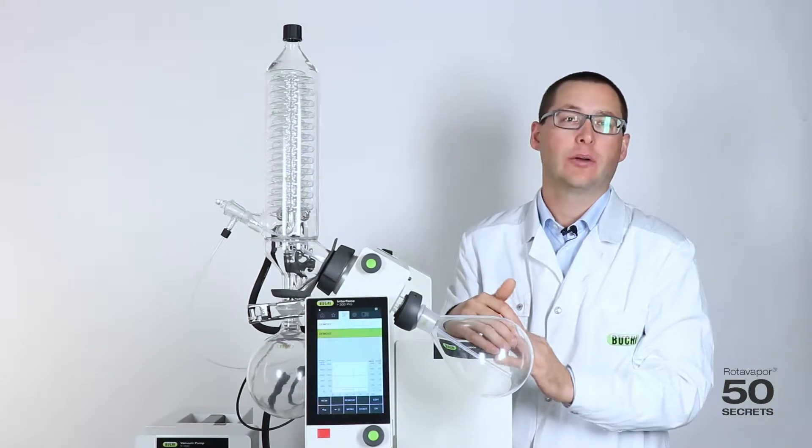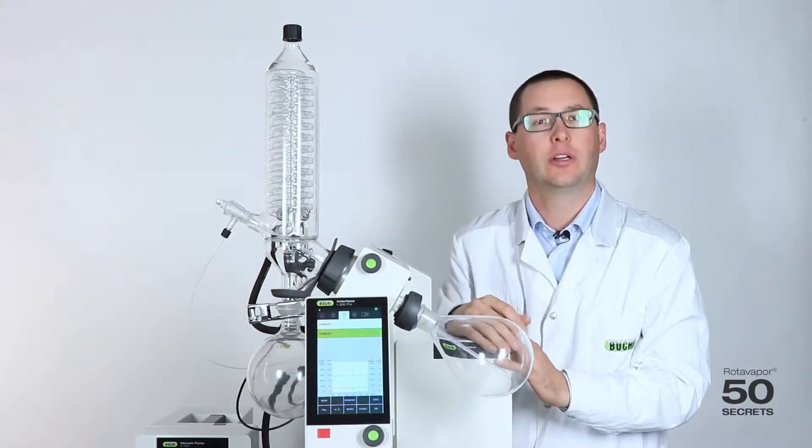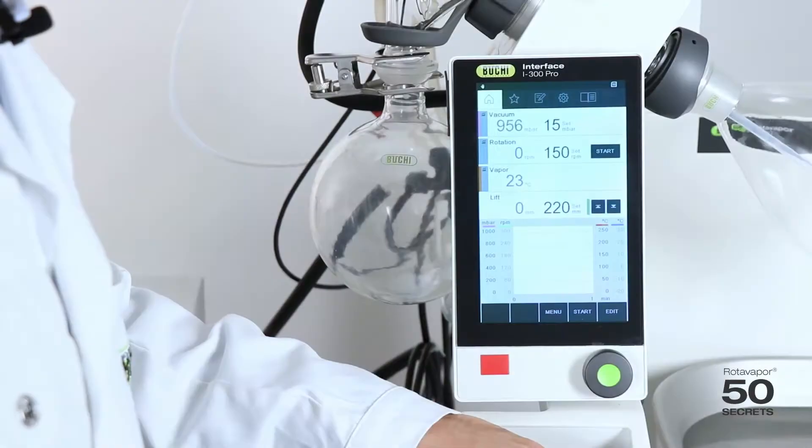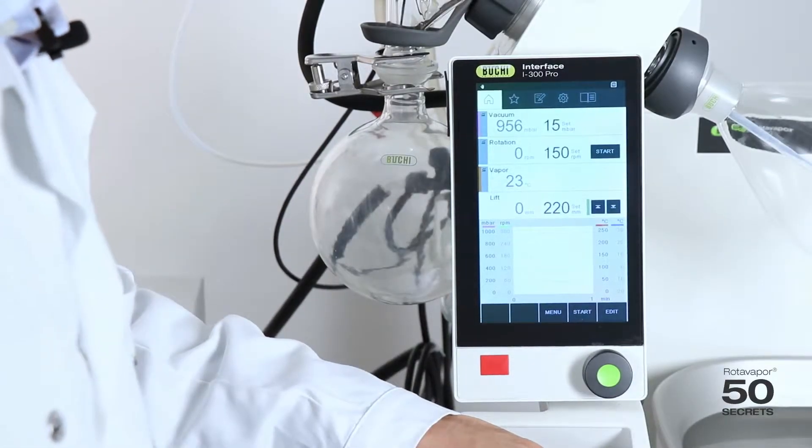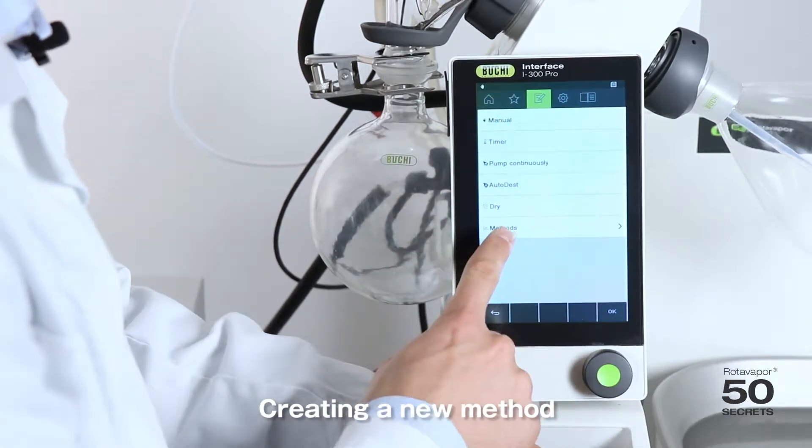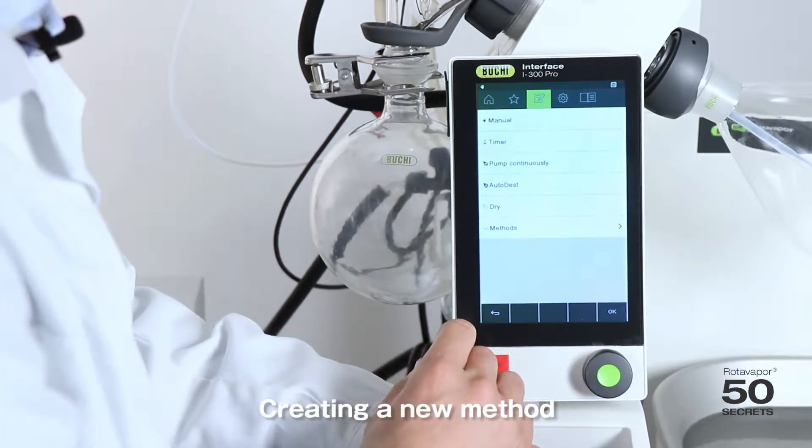Today's secret is about a feature of the i300 Pro. We call it the methods. In order to create a new method we first have to go into the operation mode methods. This is only available on the i300 Pro.